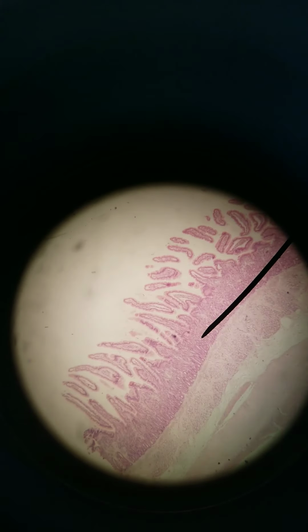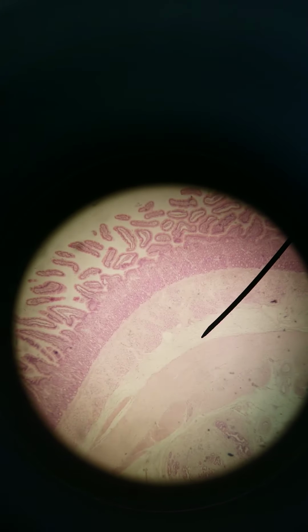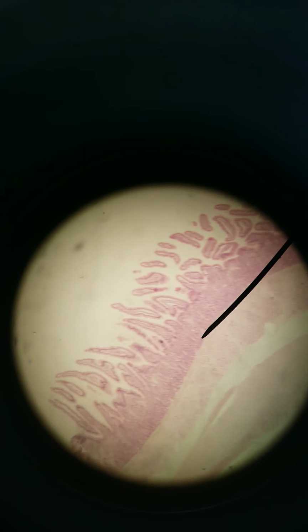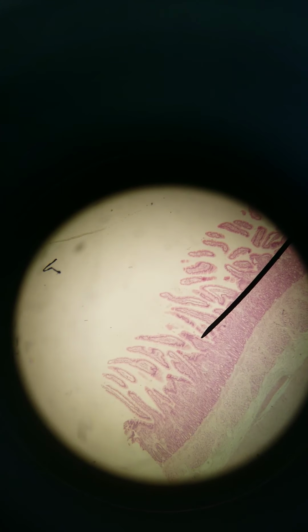After the duodenum, you know what, let me show you one more slide just to show you a different view. Here's another view of the duodenum. You can see more villi, lots more villi. When the villi kind of push up and out, that's called a plica. This isn't actually the best example of a plica, so I'll show it later. But here are great villi.